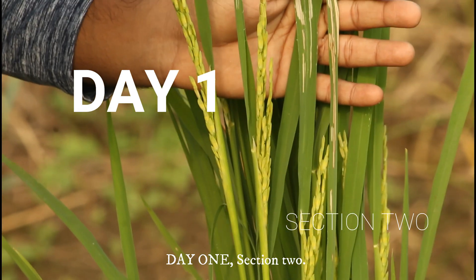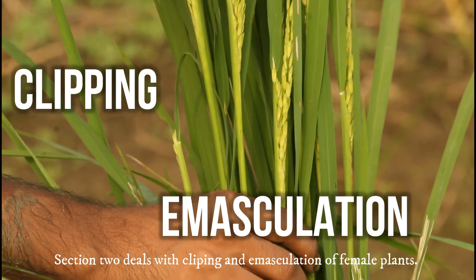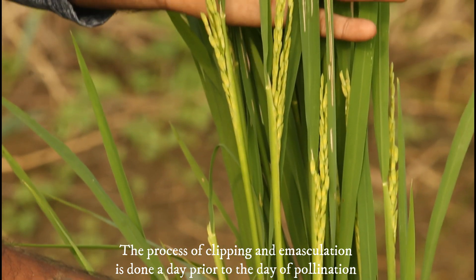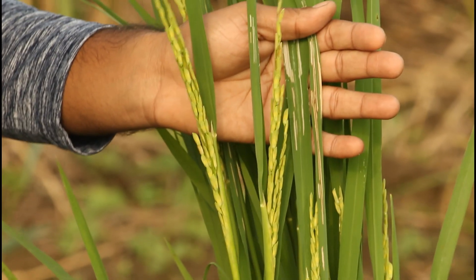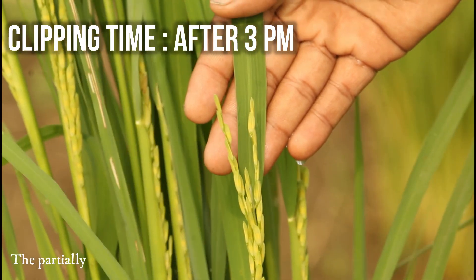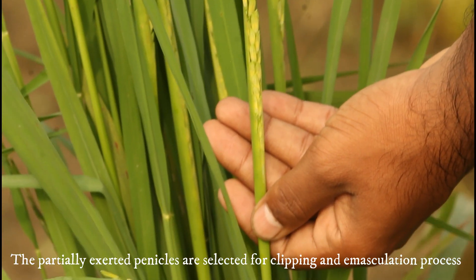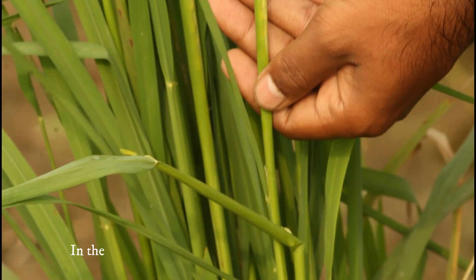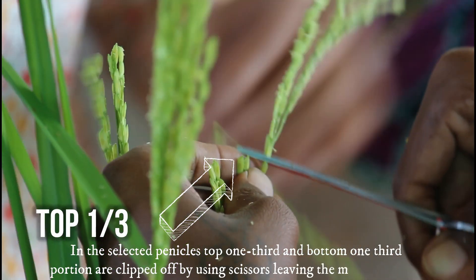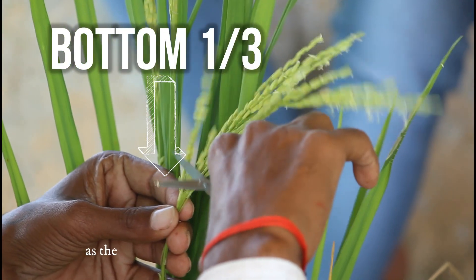Day 1, Section 2 deals with clipping and emasculation of female plants. The process of clipping and emasculation is done a day prior to the day of pollination, preferably in the evening after 3 pm. The partially exerted panicles are selected for the process. In the selected panicles, the top one-third and bottom one-third portions are clipped off using scissors, leaving the middle spikelets, as the bottom ones are still immature and the top spikelets may have already matured.